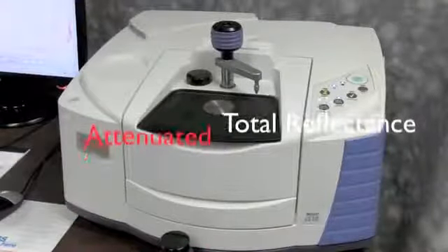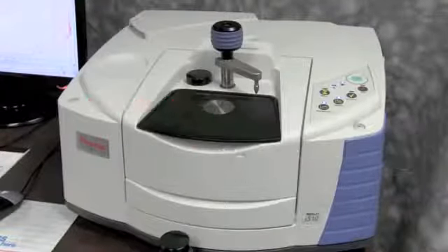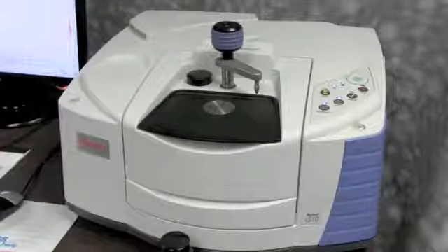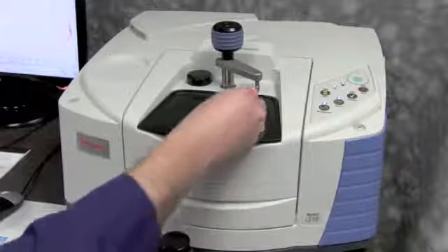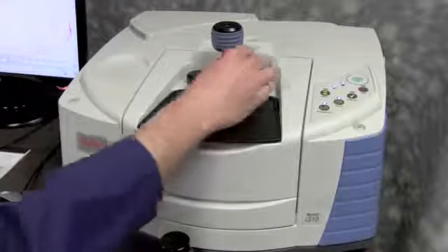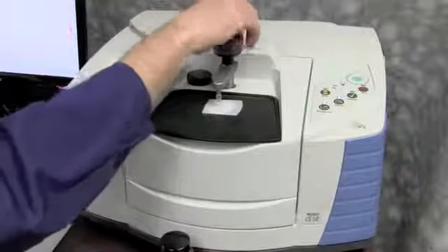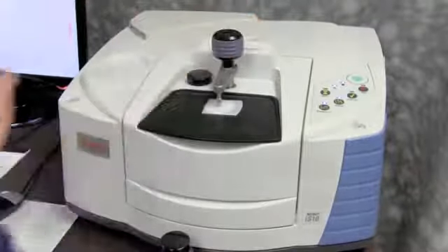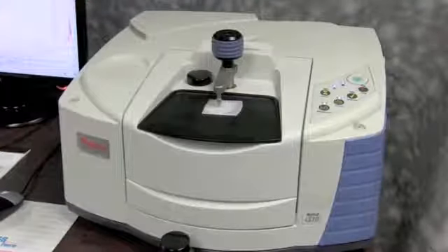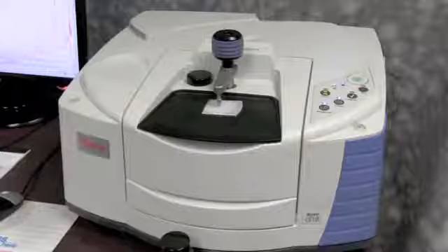Another sampling method is attenuated total reflectance, and that lets us put a solid sample on top of a crystal, and then we tighten down the clamp so that the solid sample is held in tight proximity to the crystal, and then the IR light is bounced off of that, and we sample the material in that method.